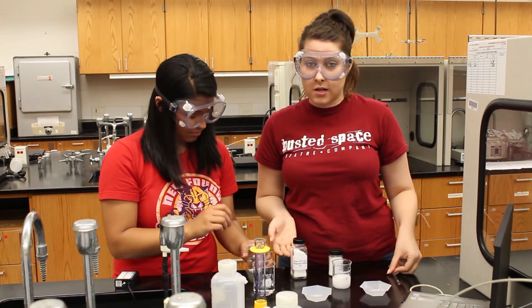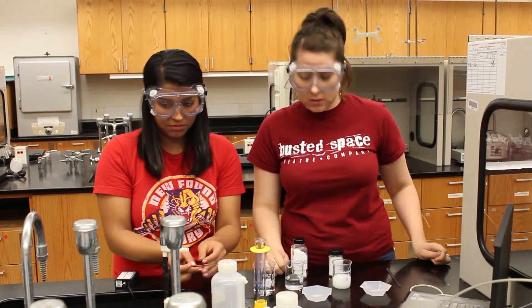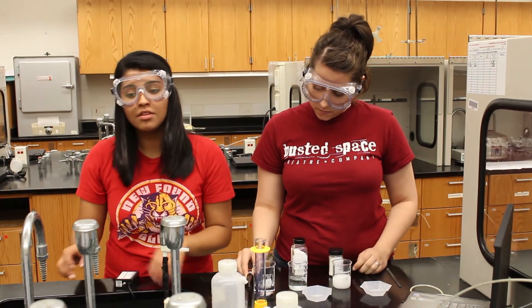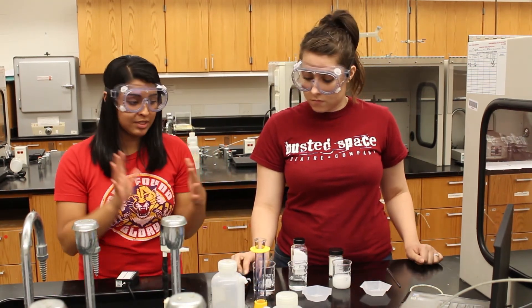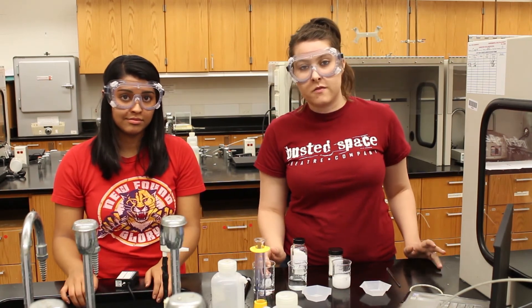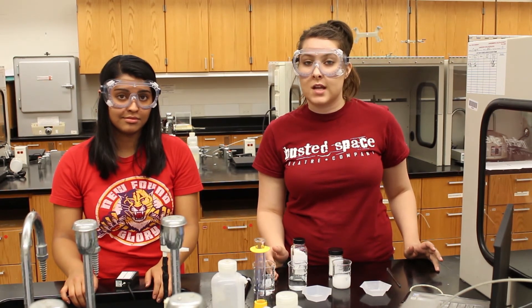Now it's time to measure the conductivity of each of these solutions. Make sure to wash the conductivity probe between testing for each solution. In the final part of this experiment, you'll use the solubility and conductivity of an unknown solution to determine whether or not the unknown is an ionic or covalent compound.